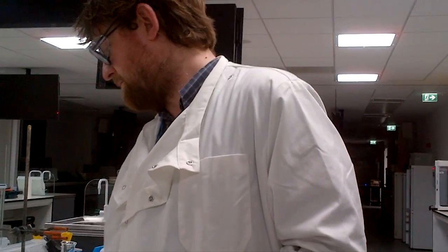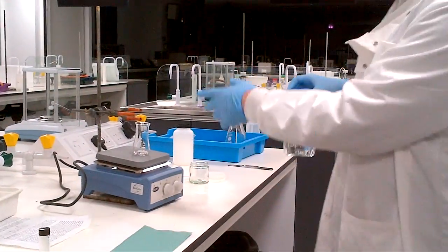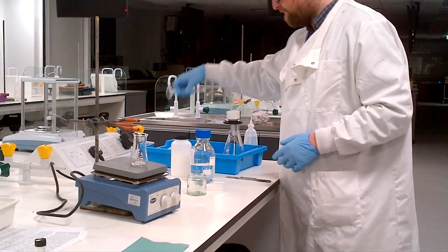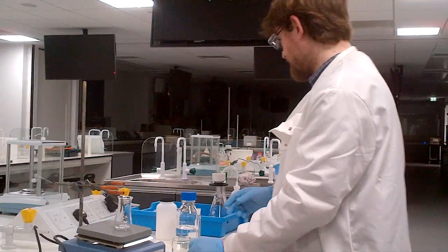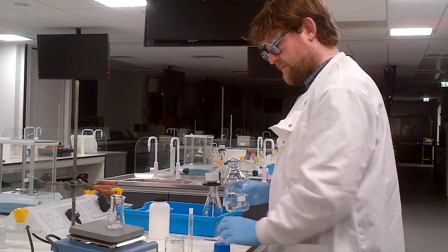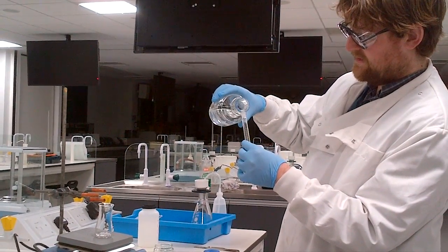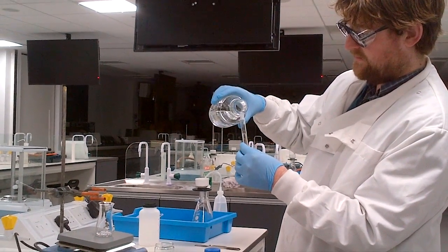So your practical procedure asks you to then take 25ml of ethanol and put the benzophenone—sorry, not the borohydride, the benzophenone—into 25ml of ethanol. I'm just going to take the measuring cylinder and some ethanol and dispense this. I've got my gloves on because this is concentrated ethanol.